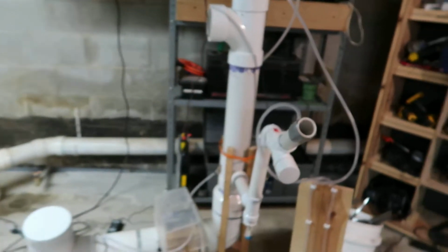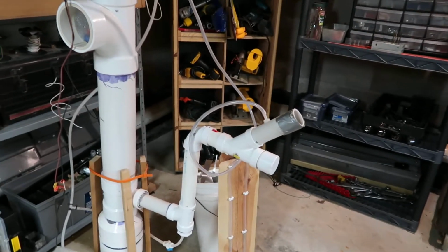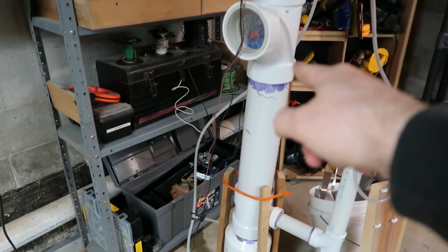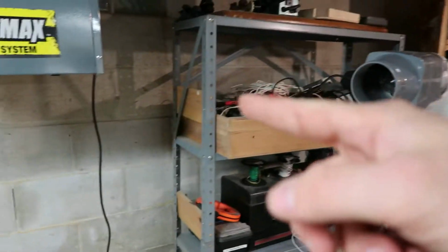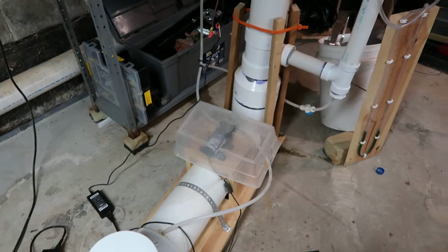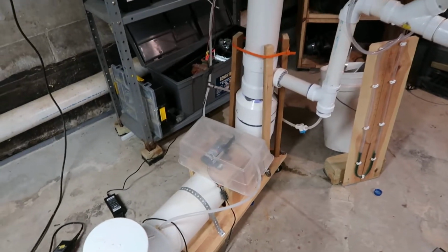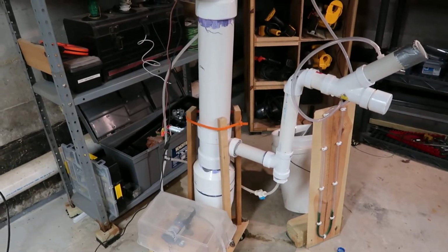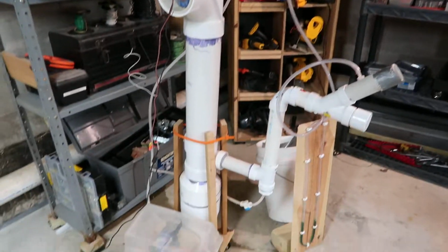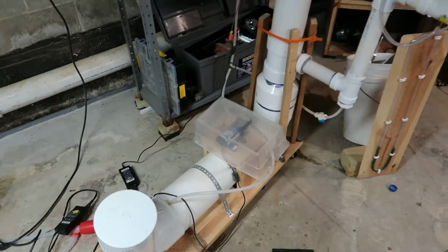So really that's all there is to it. This thing gets up and running. You have a hose connected over there, which is taken to your exhaust, whatever you want to vent through this. It goes through the primary scrubbing, it goes through the secondary scrubbing. You've got a viewer window, you've got an exit, and then you've got the reservoir down here that you have to maintain. And that's the key to having a scrubbing system that is robust and multi-use, and could potentially allow a home chemist to take on a lot more projects without risk, not only to themselves, but to the people around them.